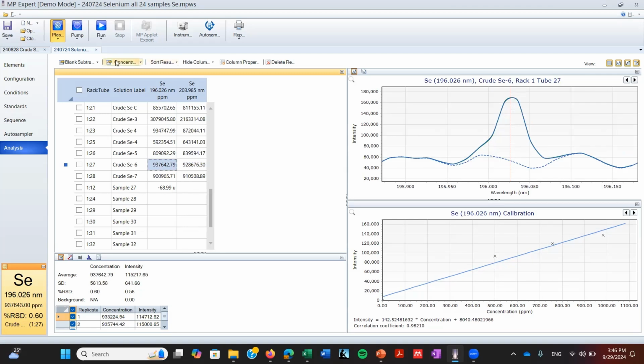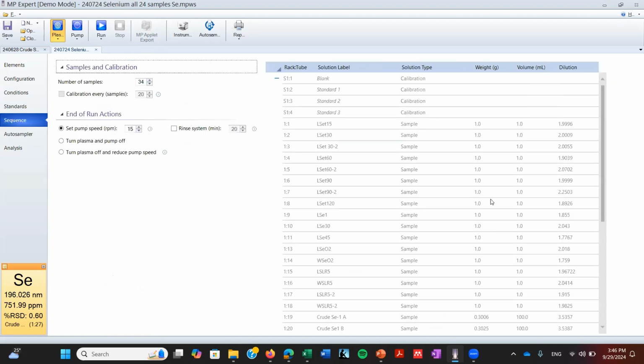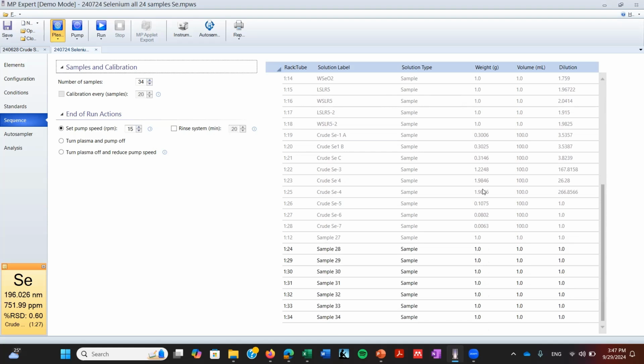So what's the difference between the concentration and the unadjusted concentration? So if you go to sequence, you're going to see that you have correction factors, the weight of the sample, the volume of the sample, or the solution, and the dilution that you did. So for example, in this one that has the three of them different than one, we can see that the initial weight that we used was 1.9 grams of a solid. And then we diluted that in 100 milliliters of total volume. And then after that, we had to do a dilution of 1 in 266.